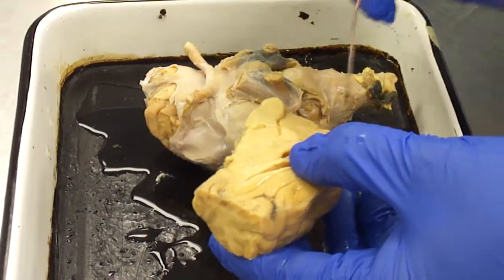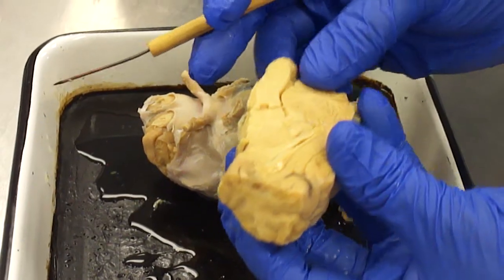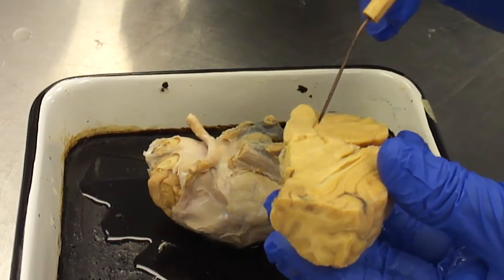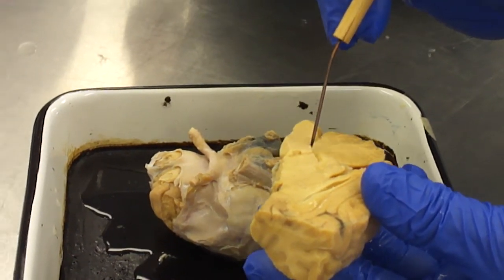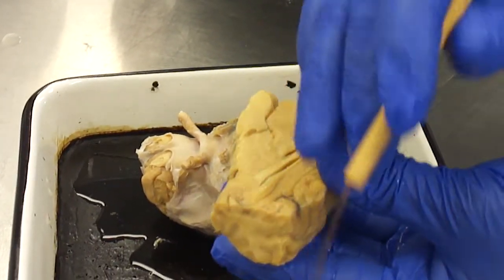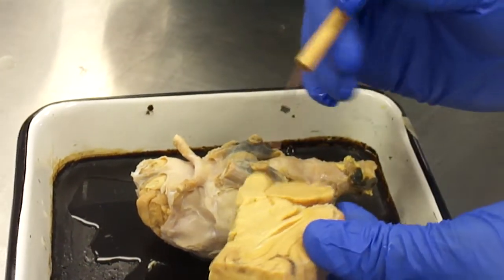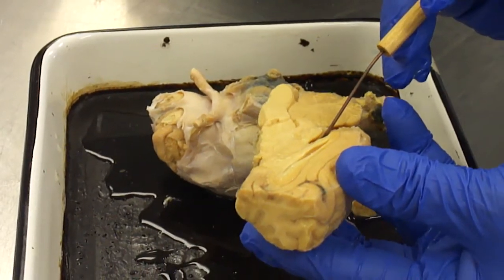Then the third ventricle is just below that here. And then the fourth ventricle is between the medulla and the cerebellum. The space isn't seen very well. If I was going to do the ventricles, I'd cut another brain open and see if I could do it better. This was cut open with a scalpel. What you need is a nice knife to get it cleanly cut. So those are the ventricles. So it's just the space.